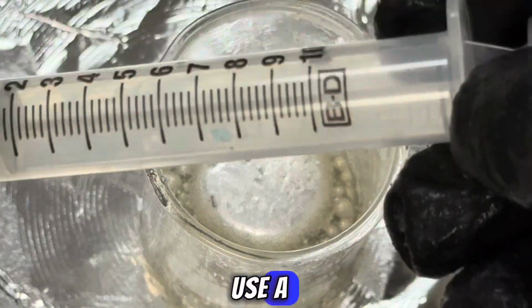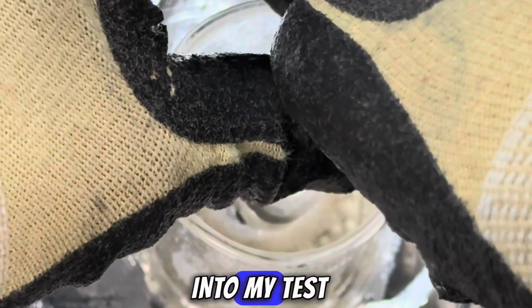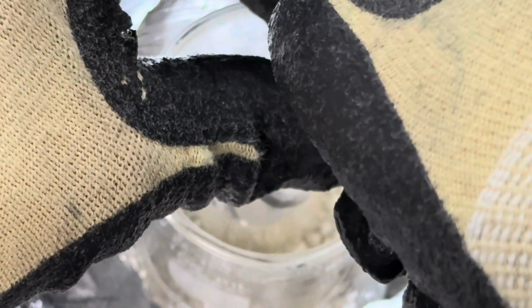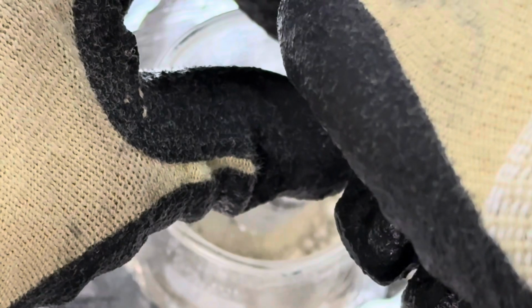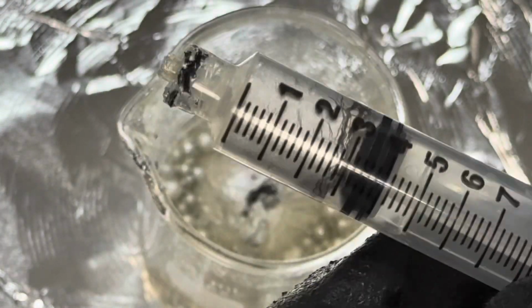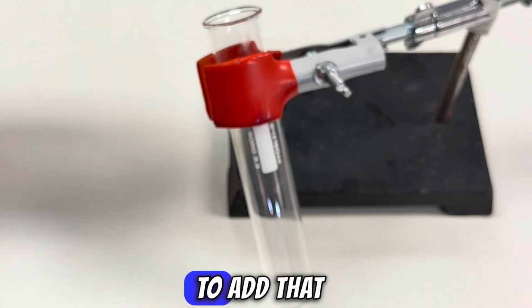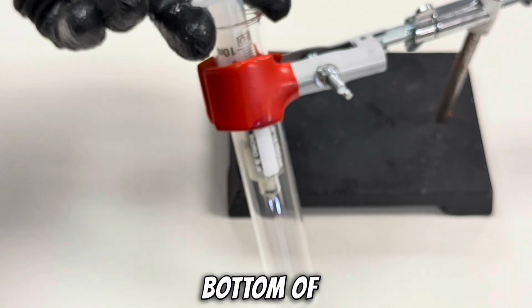Next, I'm going to use a syringe to draw some of this out to put into my test tube. There it is. Okay, and now we're ready to add that to the bottom of our test tube.